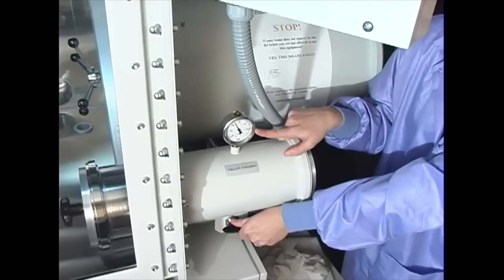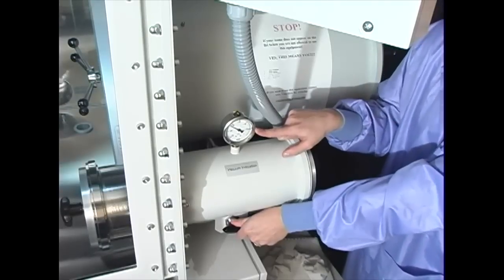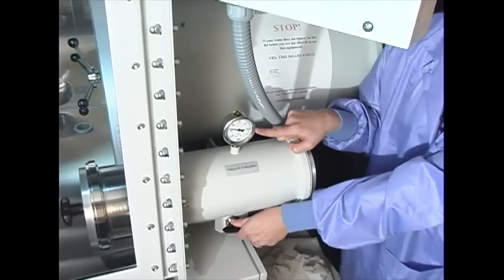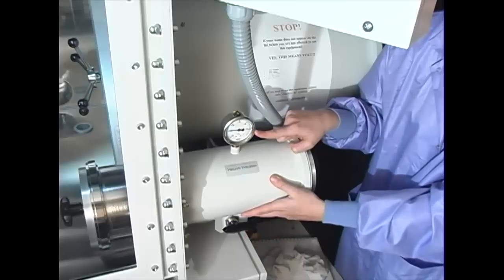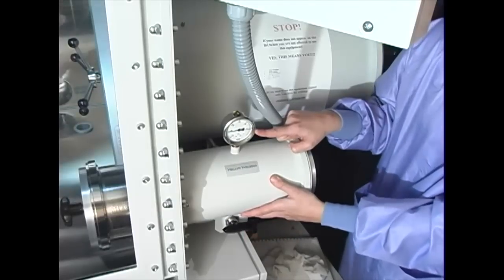The inner door can then be opened and the objects moved into the glove box. These materials will never again contact atmospheric oxygen through the whole procedure.